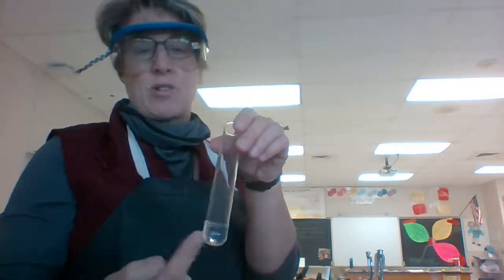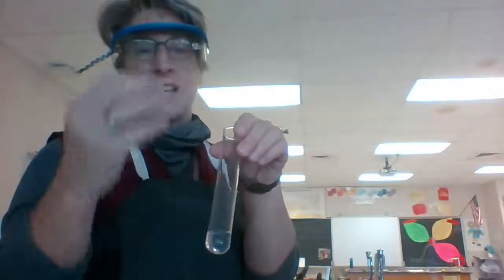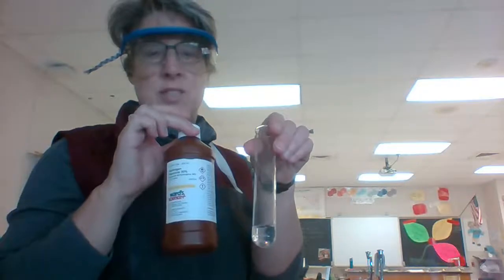But as the sun starts to hit it, every time you open the bottle, close the bottle, it will start to decompose from one reactant into several. So I poured some hydrogen peroxide into here. Currently, right now, it is decomposing. Now, you can't see this reaction, and it's happening at a very, very slow rate. It's decomposing into water and oxygen gas. So right now, water is building up in here, and oxygen gas is coming off as this chemical decomposes.